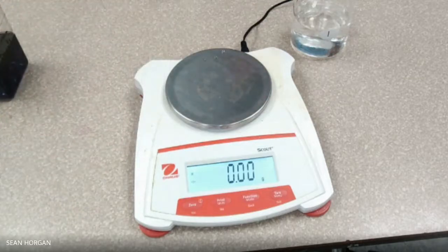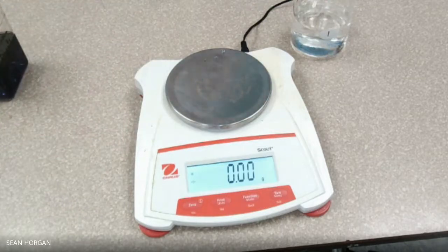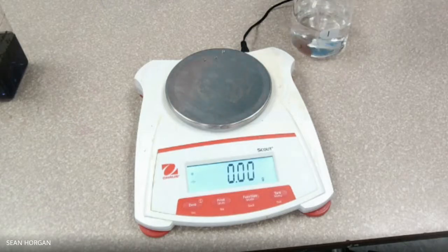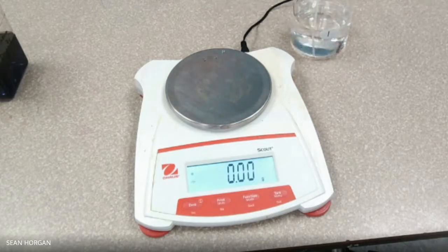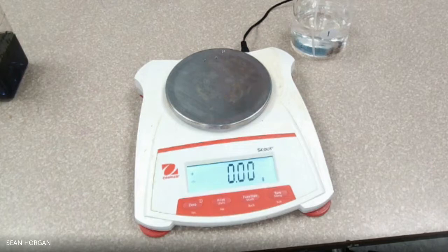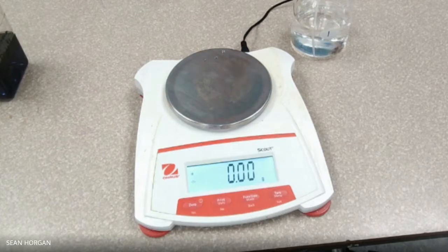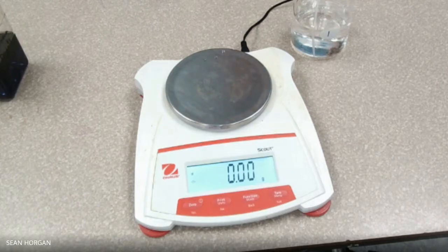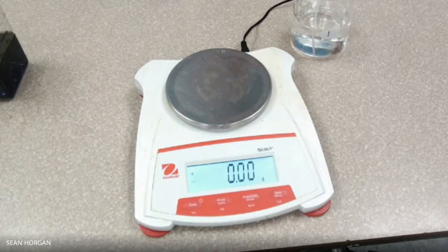So we're going to have two different variables here. The first one is going to be the independent variable, which is going to be the volume. And we're going to measure two centimeters cubed — or milliliters — four milliliters, six milliliters, eight milliliters, and ten milliliters of water.